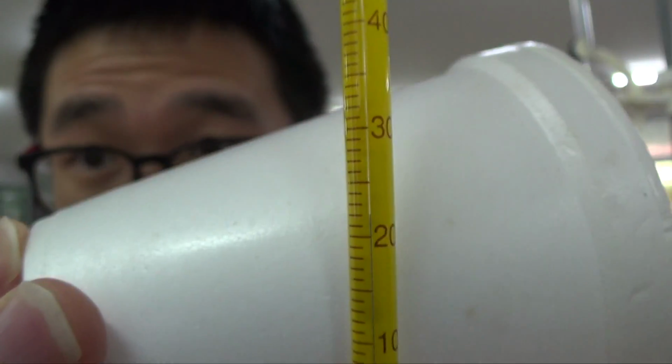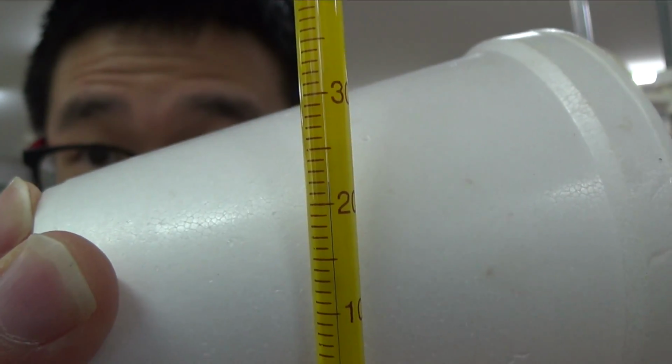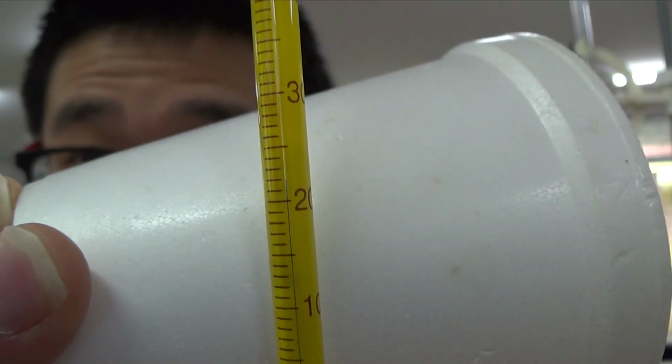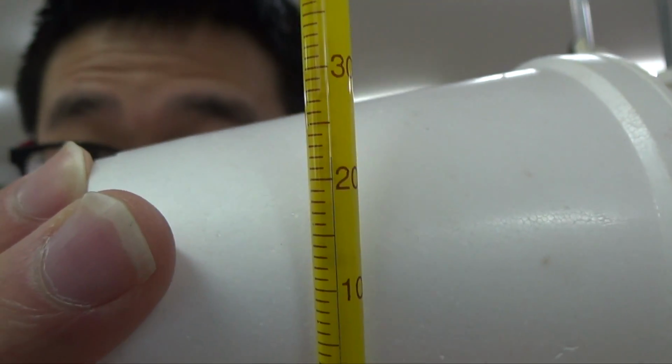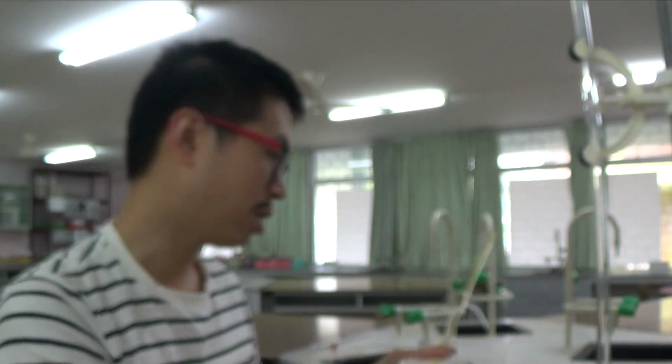22.0. Yep, you can hopefully see the silvery line now. Well, it's not really silver inside, I think it's mercury inside. What happened then is you got 20 at the bottom and 30 on top, so you're reading from the bottom to the top. There's 21 and 22.0 to the nearest 0.5. There's 22.0 degrees Celsius. I'm just going to write down and record my temperature into this column here.